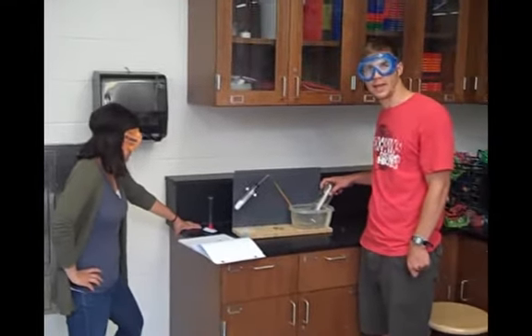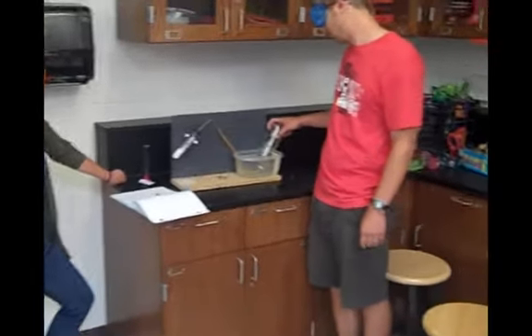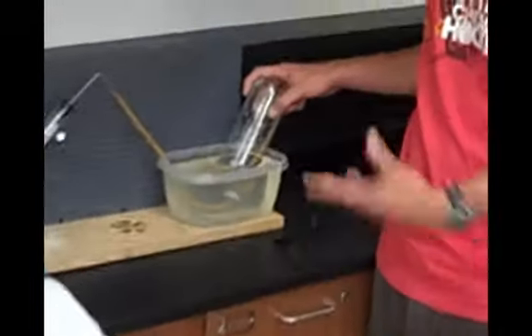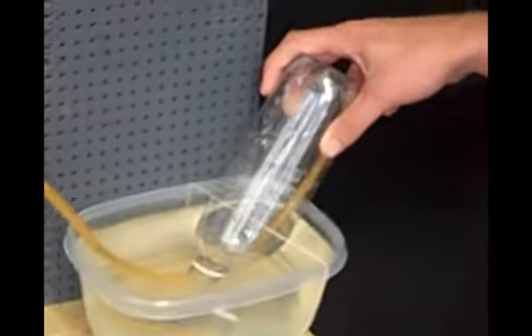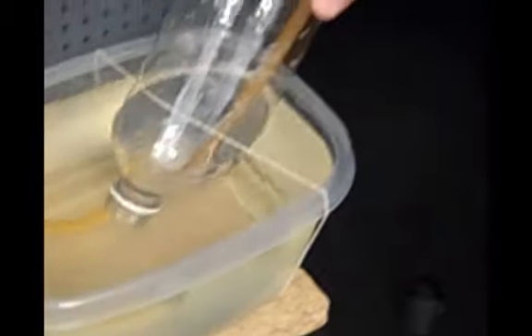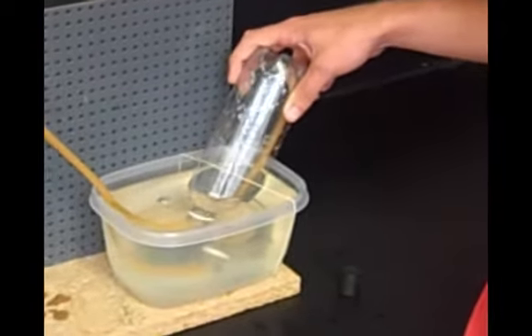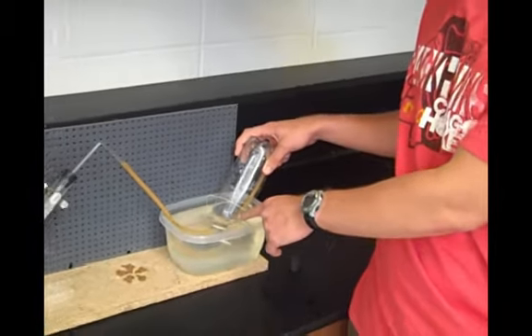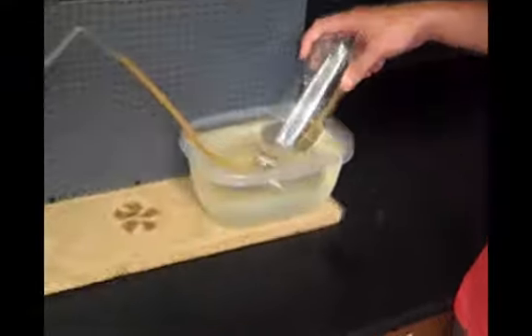So as we get towards the end of the dissolving of the Alka-Seltzer, this bottle gets pretty buoyant because of all the gas that's in there. You can see most of the water has been displaced with the gas. And I'm going to have to hold that down to make sure that the bottle isn't floating up and getting atmospheric gases inside of the bottle, only the gas created by the Alka-Seltzer. I know that I'm done when I have bubbles coming out of the mouth of the bottle. That's how I know that the bottle is completely full of gas.